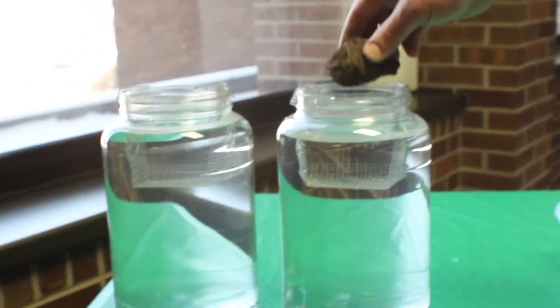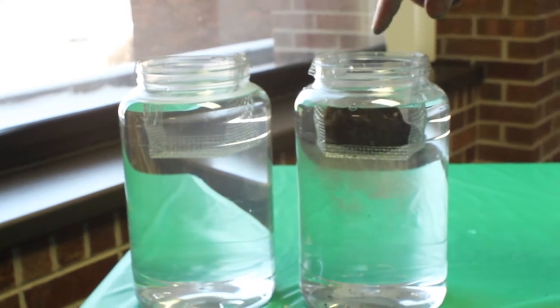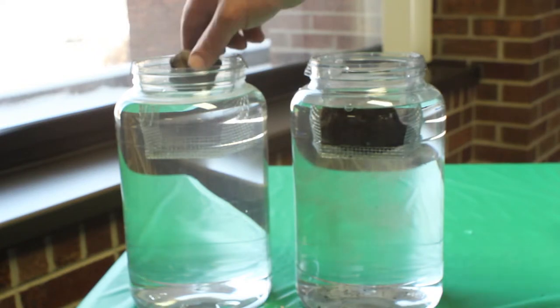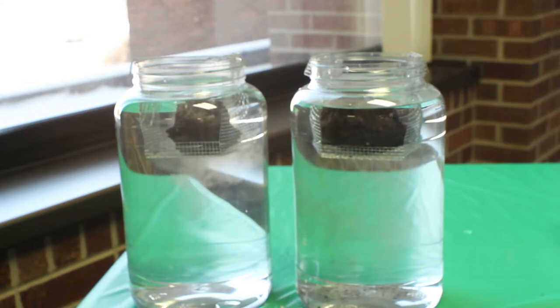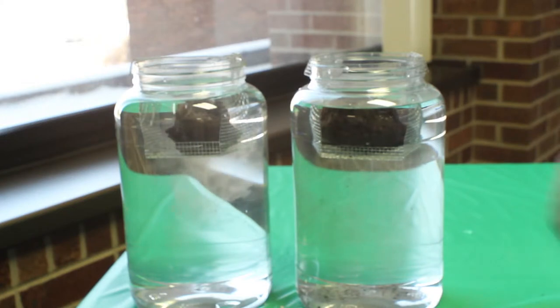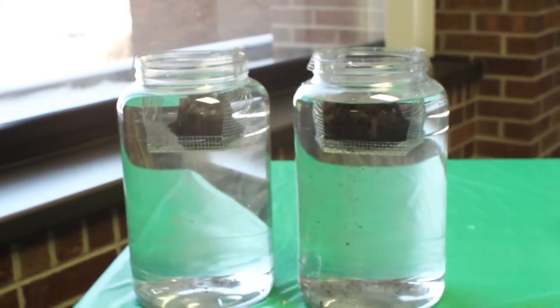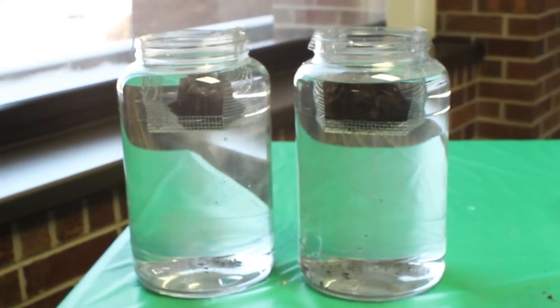As we immerse that clod, you can actually see the bubbles coming up — water rushing in and air coming out. Then we'll immerse our conventionally tilled clod as well. In both cases, we're actually seeing soil particles fall off. However, the question is to what extent the clods are actually falling apart, and how cohesive that actually is over time.